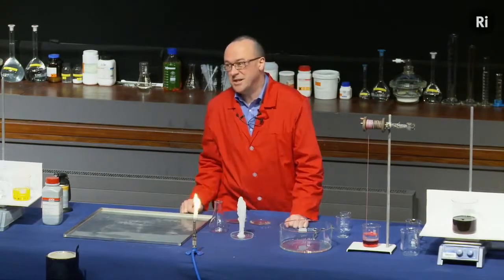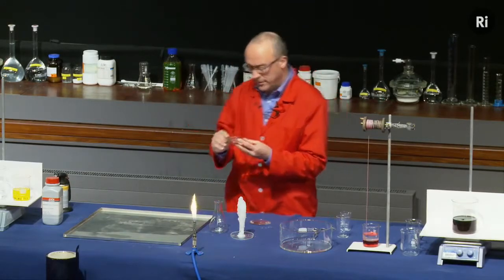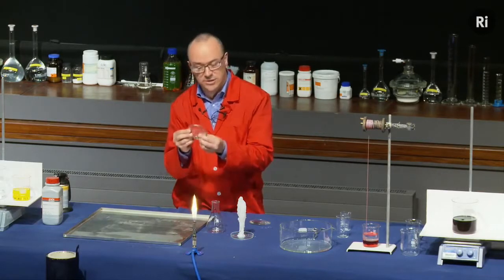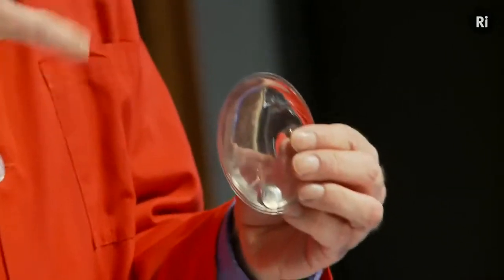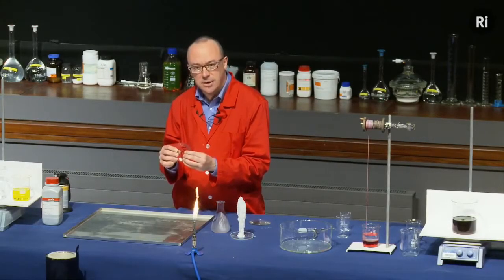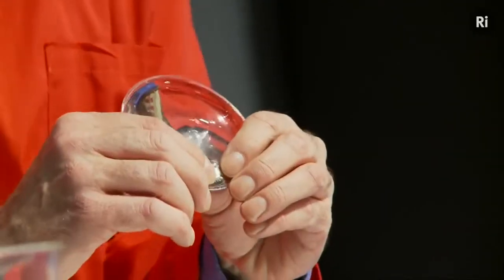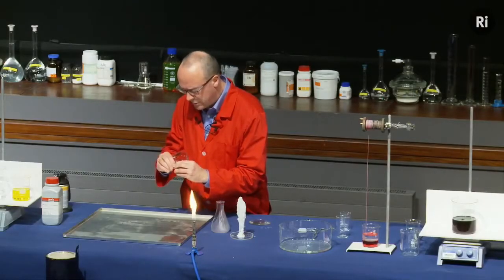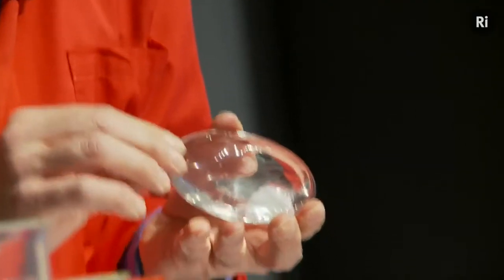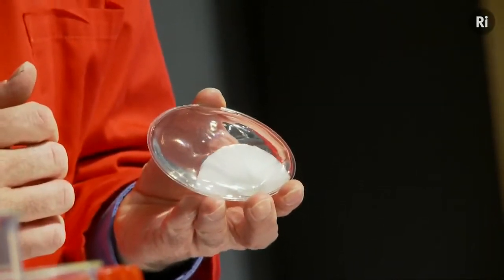Now, oddly enough, this actually has a practical application, and this is the practical application. This is something called a hand warmer, and it's a plastic pouch, and it contains exactly the same liquid as in this flask. It's a solution of sodium acetate, and it would like to turn into a crystal, but it needs an excuse to get going. And the excuse is this little metal disc, and if I just flip this disc backwards and forwards, that should be enough just to start the crystallization off, and there it is. And we can see the liquid turning into a solid.